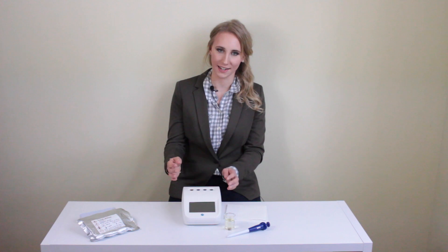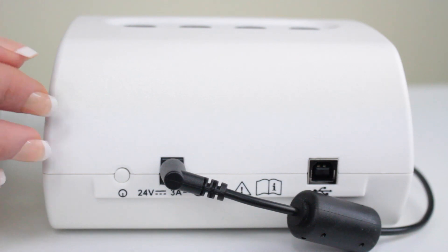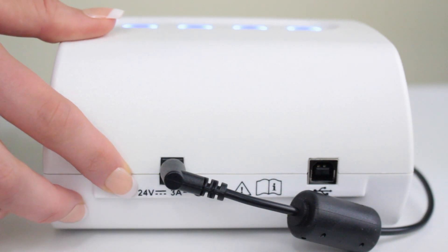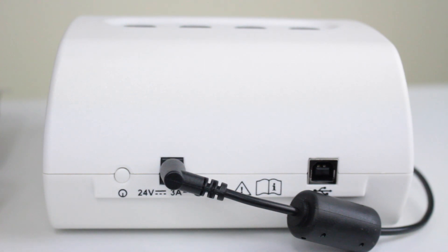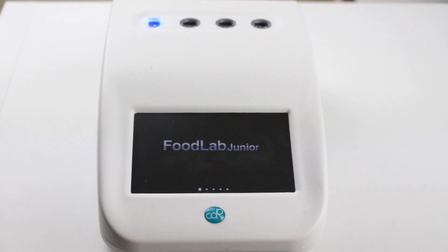Today we are going to go over how to test for free fatty acids in your oil using the Food Lab Junior analyzer. To begin, you'll want to start by powering on your unit by pressing the power button located in the back. Upon doing this, you'll see the blue lights and screen turn on.